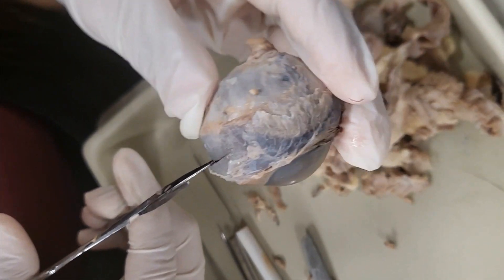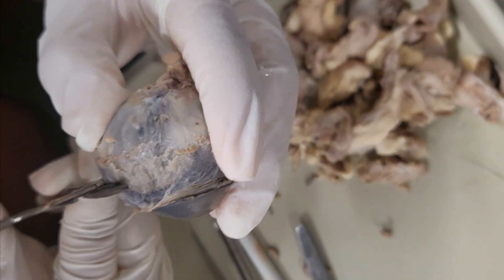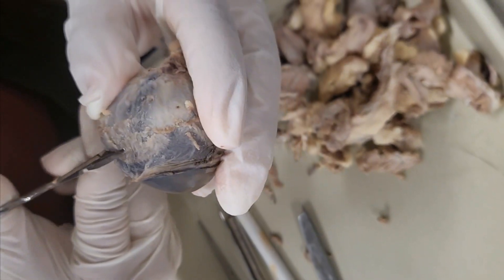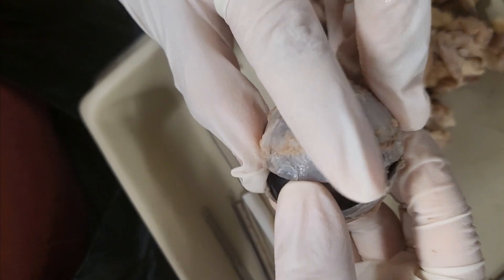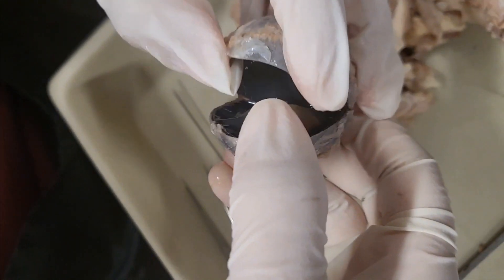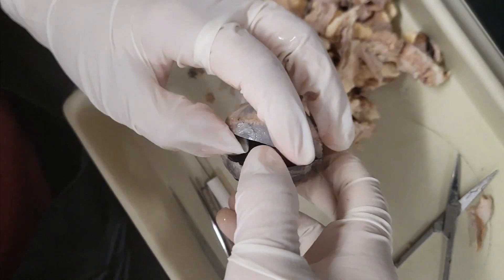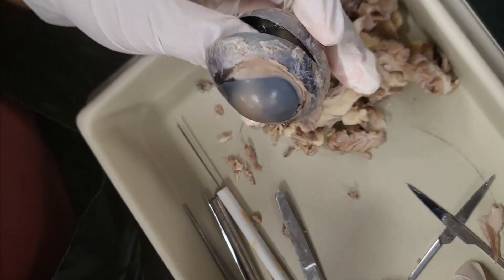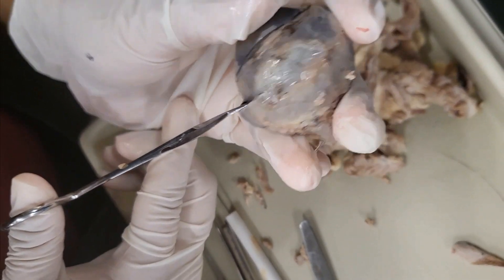Can you see the inside now? No, I can't see it. What's falling out of it? Oh, that's the vitreous humor I think. Let's cut a little bit more, yeah, so you can see a full bisection of it.